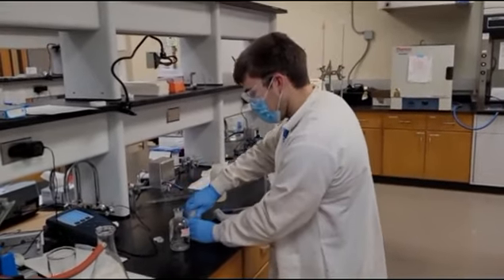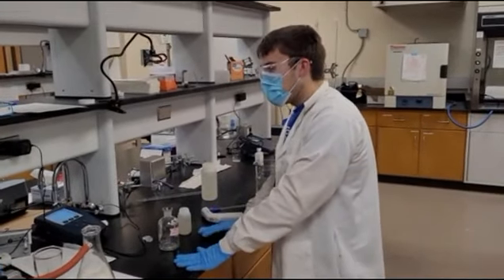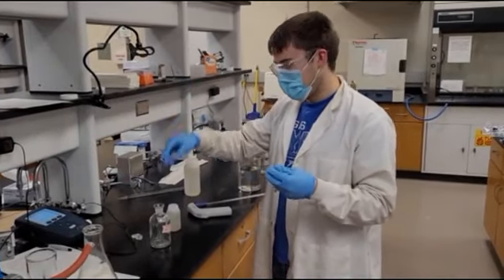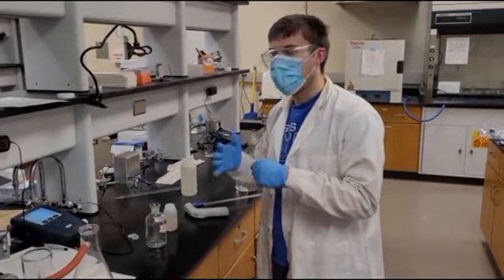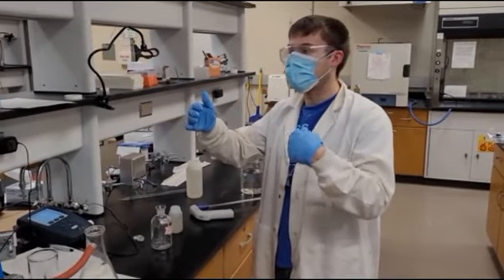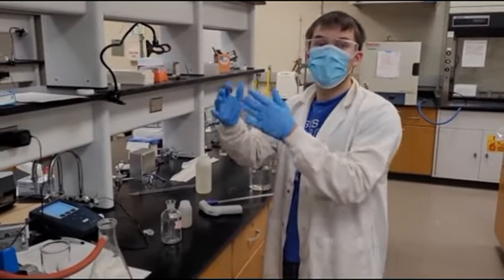And we'll start with BOD for the influent. The BOD for the influent wastewater is around 150, and as you know, the dissolved oxygen for water is around 9. For the rules of the BOD test, the final DO cannot drop below 1, so we only have about 8 milligrams per liter oxygen demand that we can measure, so we have to dilute it.